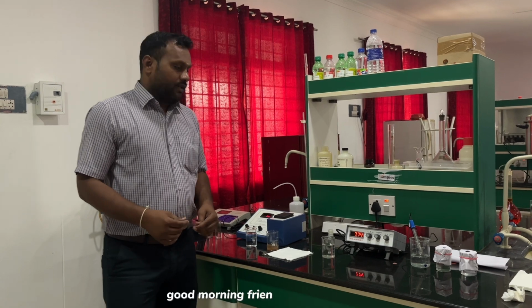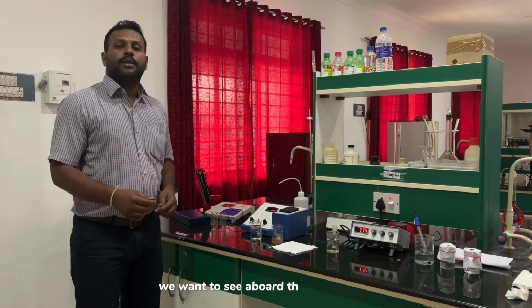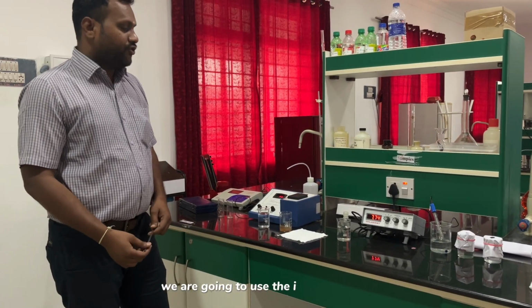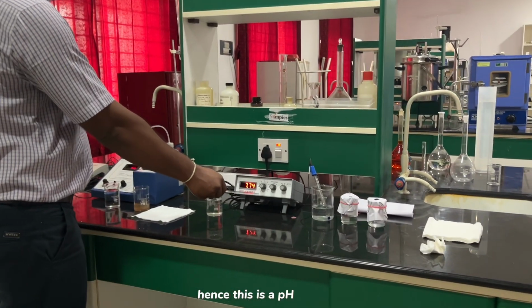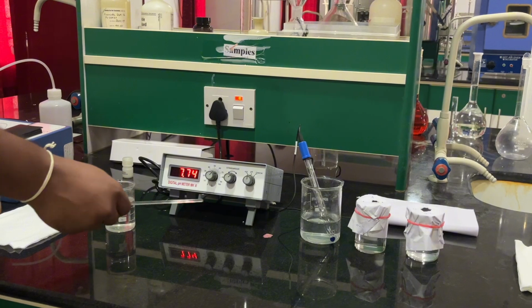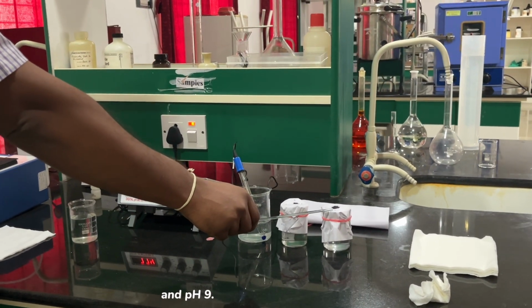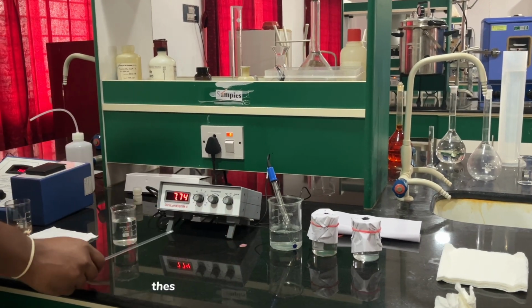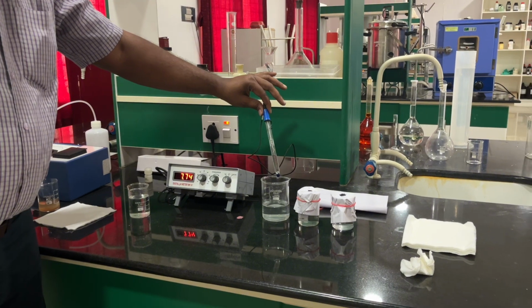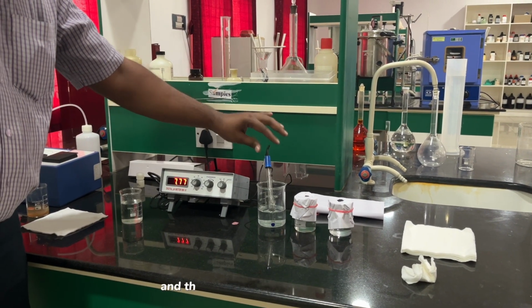Good morning, friends and students. Today we are going to see the laboratory experiment on pH and turbidity. Here we are going to use the instrumental method. This is a pH meter for identifying the pH of water, and we have already prepared solutions of pH 4 and pH 9.2 in these two bottles. These are all the apparatus required for the pH meter, and this is an electrode that measures the pH in water, and this is the pH meter.